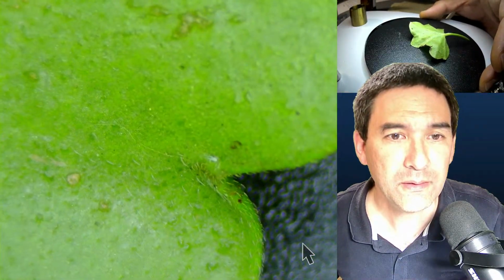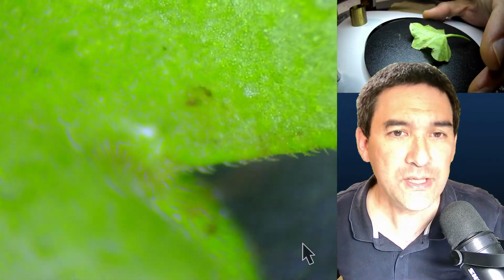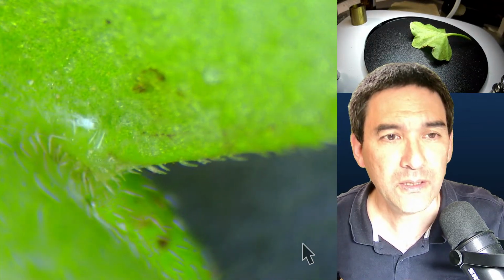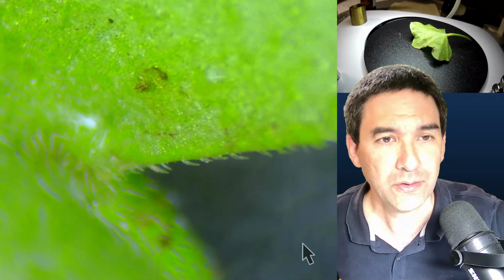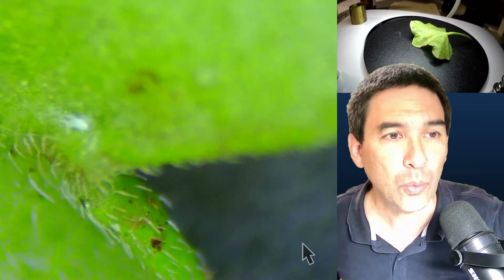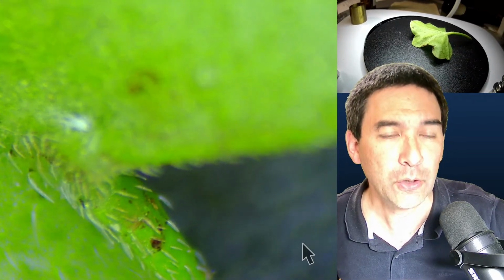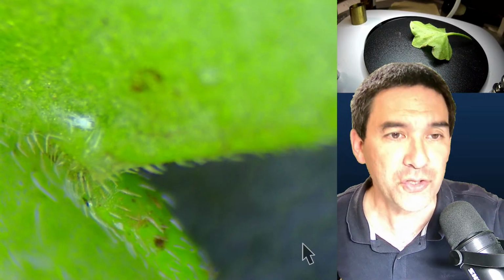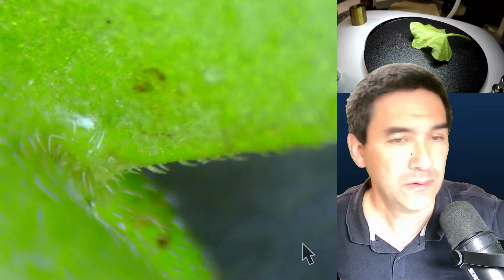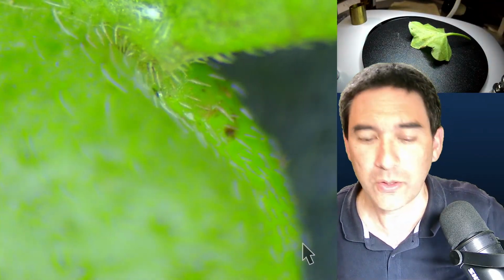Let's see. Here you see some of these on the side. You always have to check the edges, right? And you see over here that there are these tiny little protrusions. I don't know what function these ones specifically serve, but I know that some plants actually have a lot of them growing right around the stomates to reduce the loss of water vapor. Here under the stereo microscope, you're able to see them quite well.